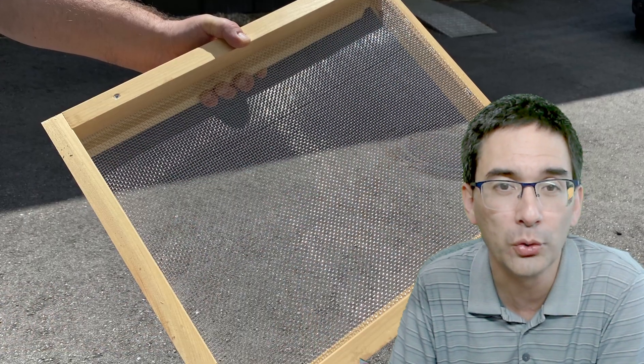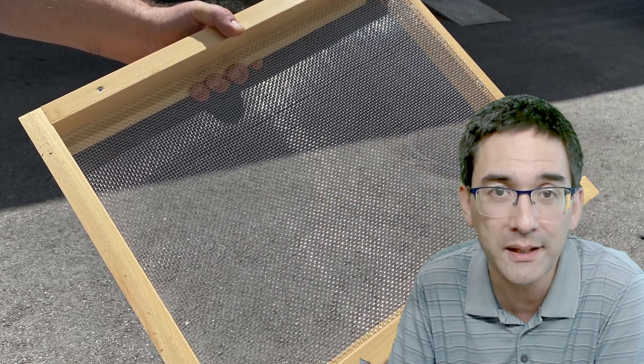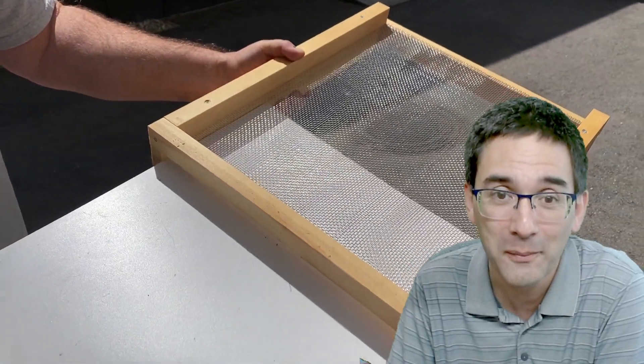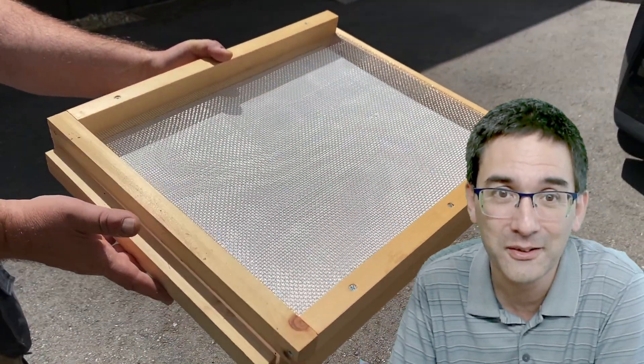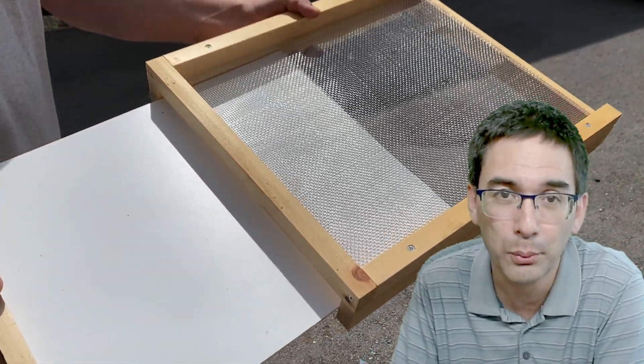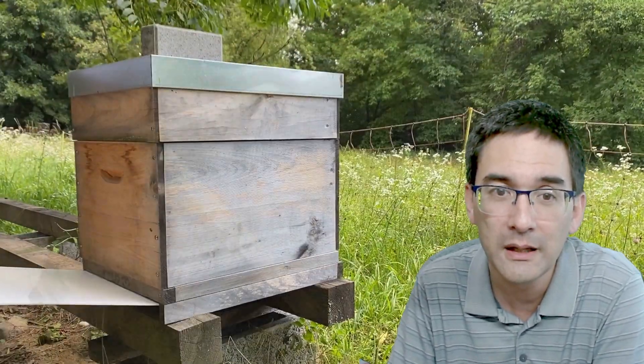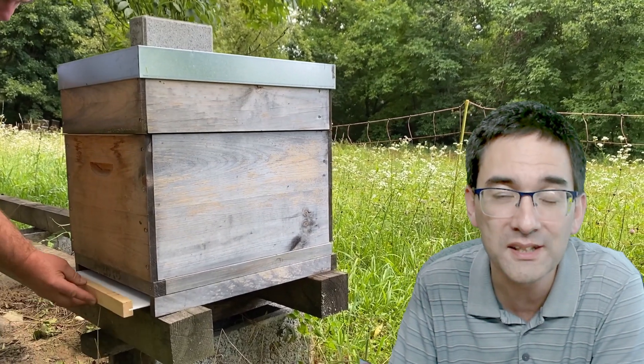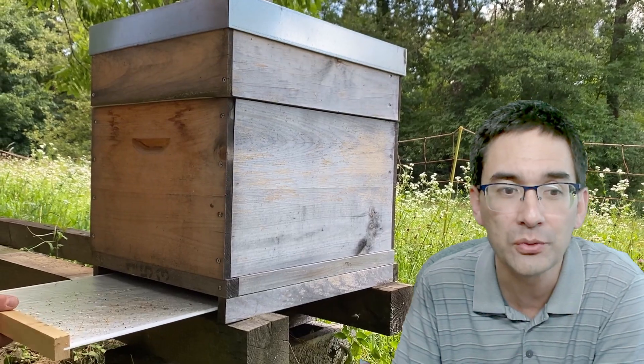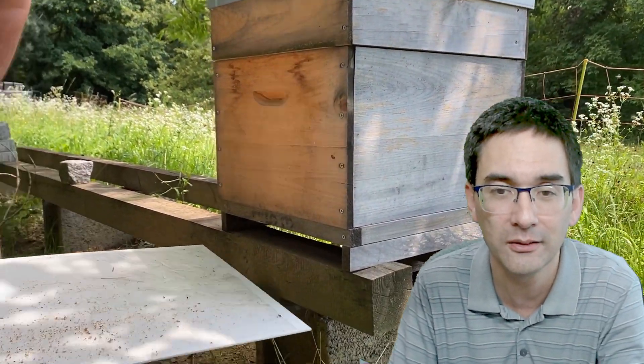I want to now show you how those mites are collected. I got these video clips from my student, so she was kind enough to make those videos. You can see that you push and pull in this little board, and on this board they put a sticky foil. You leave it in there for a day, and after a day when you take it out, you actually get what I just showed you.